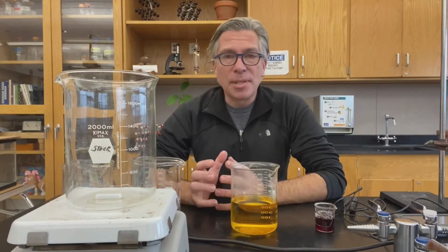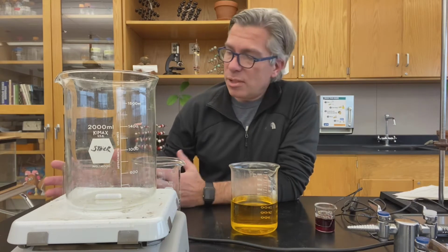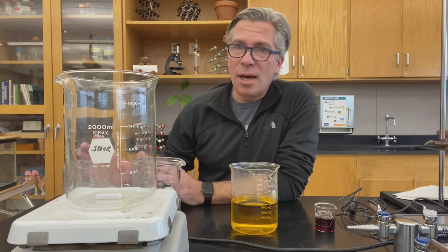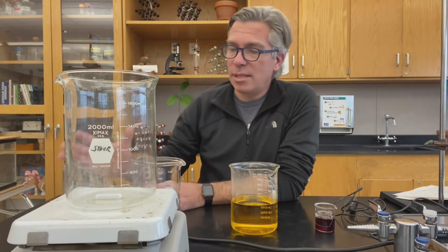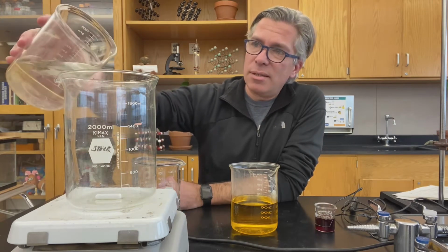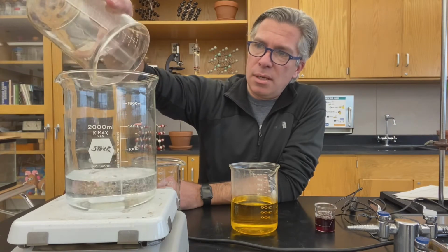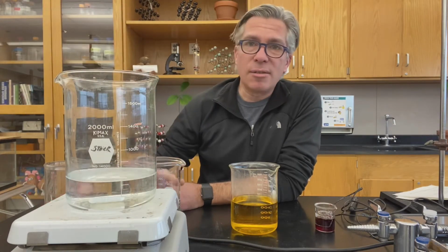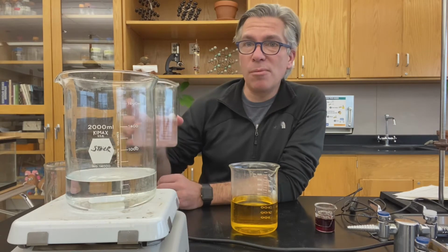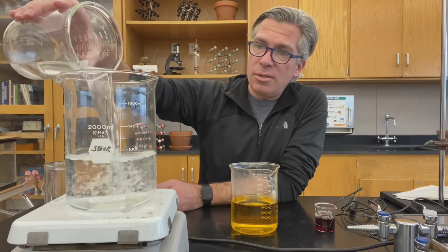Hey everyone! Today we're mixing up an oscillating reaction. I'll talk more about it as it goes, but I want to start mixing. I have 4 solutions here that I need to mix together. The first is a mixture of potassium bromate dissolved in water, and we're going to add that to our beaker. The second is a solution of potassium bromide and some malonic acid. That is also going in.